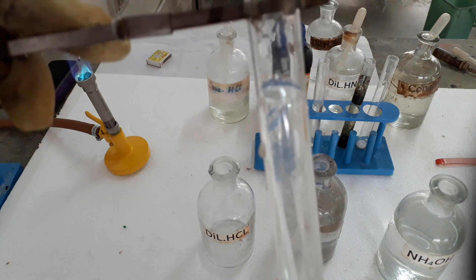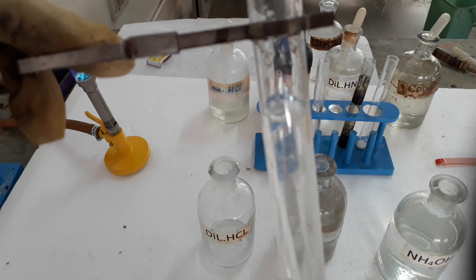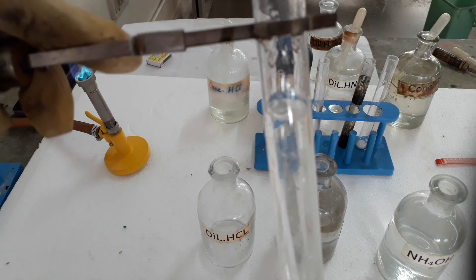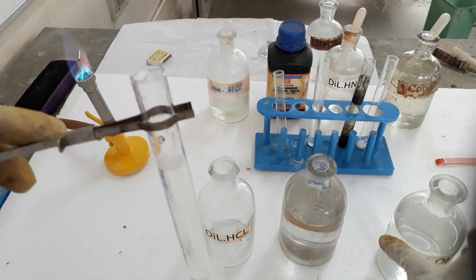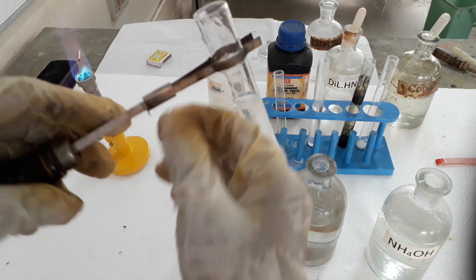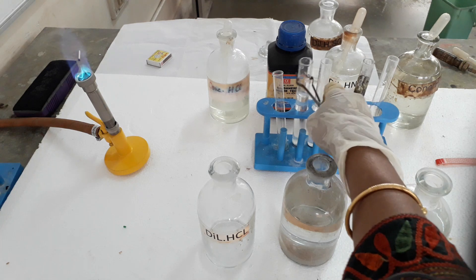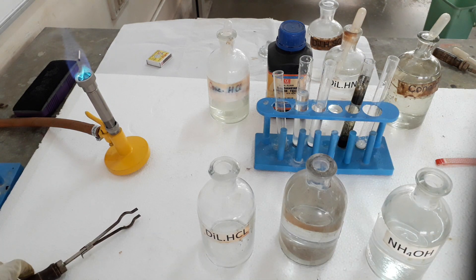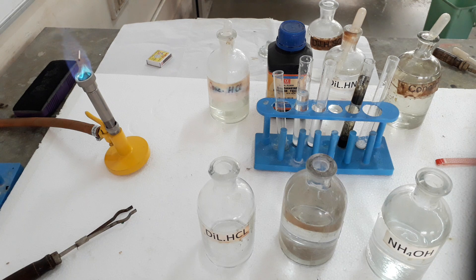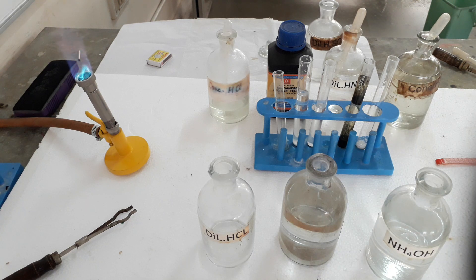So we are getting a clear solution of diamine silver chloride. AgCl curdy white precipitate dissolves in excess ammonium hydroxide forming diamine silver chloride, and this is the confirmatory test of chloride — we can also say it is the test of dilute hydrochloric acid. Thank you students.